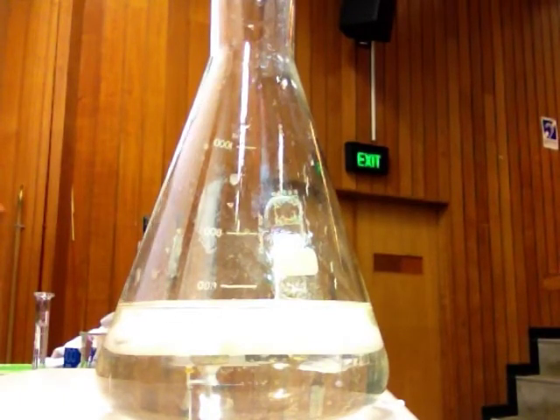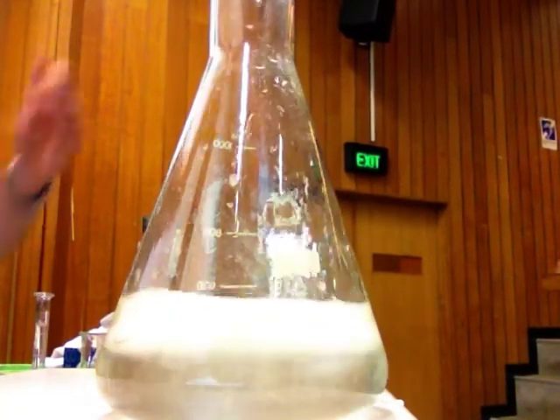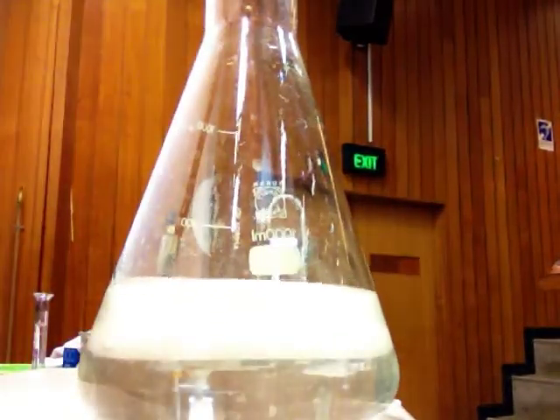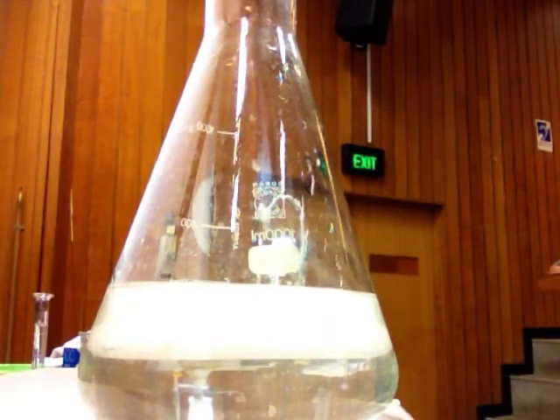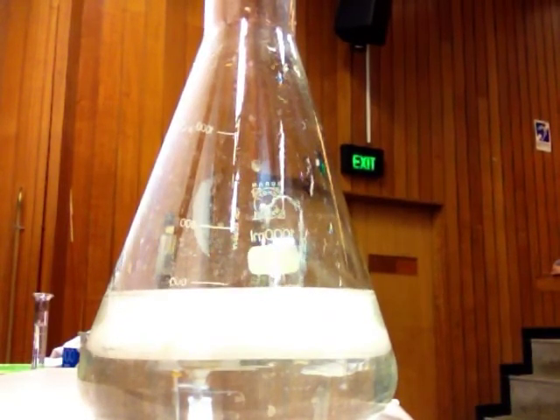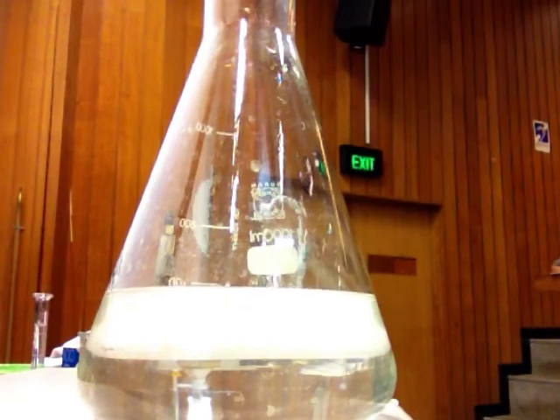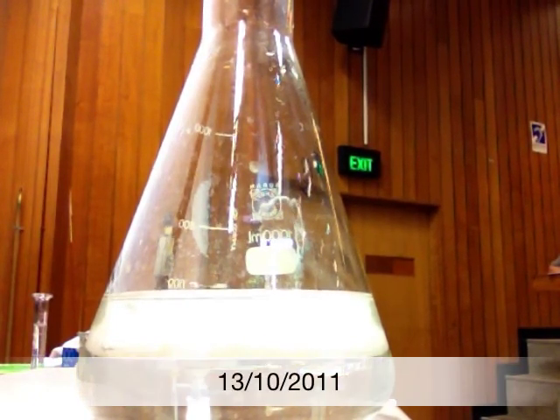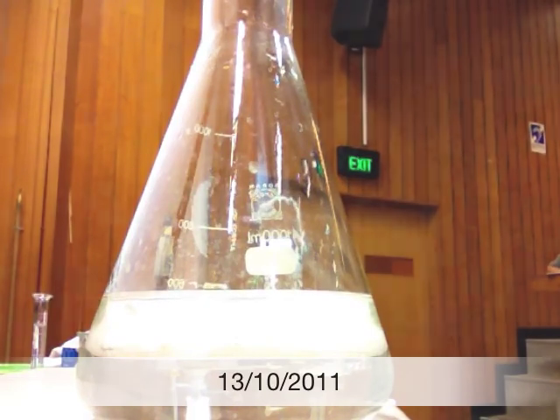And then lastly I can take it all the way down and actually turn it colorless. So my last one is all the way down to Mn 2 plus, which is all the way down to D5. Okay, so we can swap the oxidation number pretty easily up and down, and we'll talk about this a little bit more tomorrow.